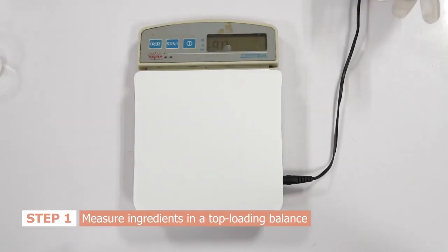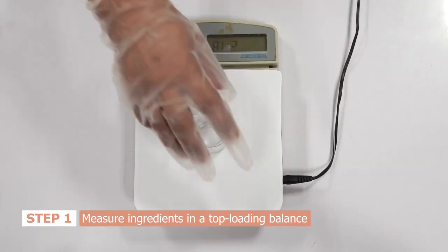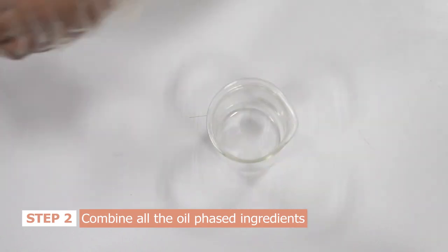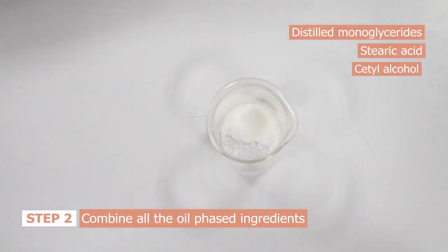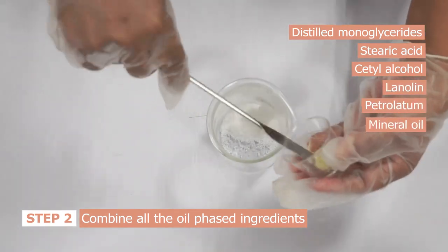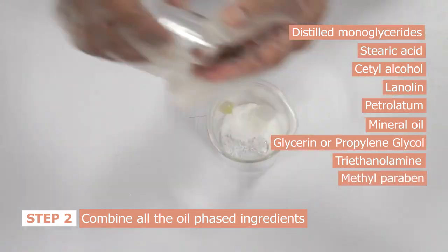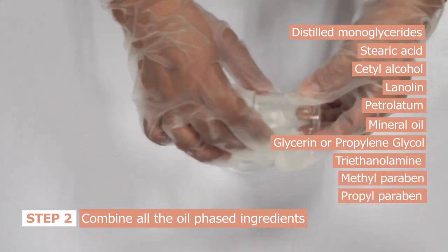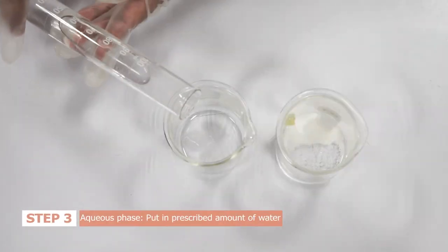Let us make the hand and body lotion first. Measure all the ingredients separately in a top loading balance. In a container, combine all the oil phase ingredients: distilled monoglycerides, stearic acid, cetyl alcohol, lanolin, petroleum jelly, mineral oil, glycerin, triethanolamine, methyl paraben, and propyl paraben. In another container, put the prescribed amount of distilled water. This is called the aqueous phase.